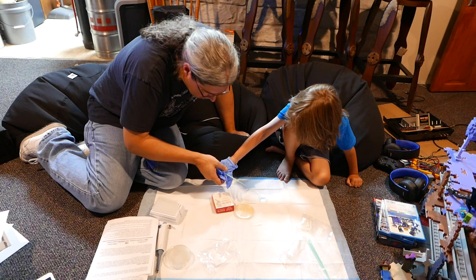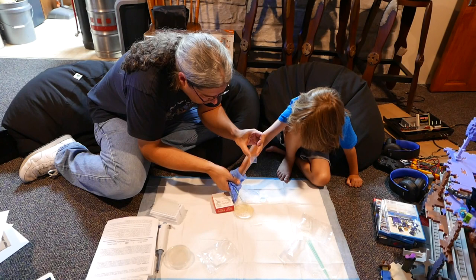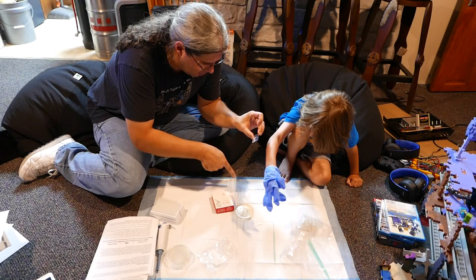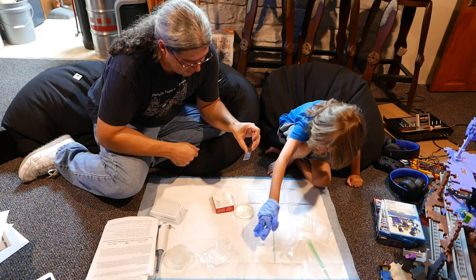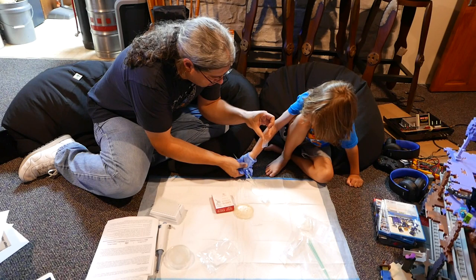You want to get some under? Oops. That would be your fault. Yes, it would be. Here, set it down. Turn this lid over — turn it over. Turn this lid over here. Pick that up again. Let me get some of that water. Just dew it a little bit. Alright, I'm going to stick that down over there.